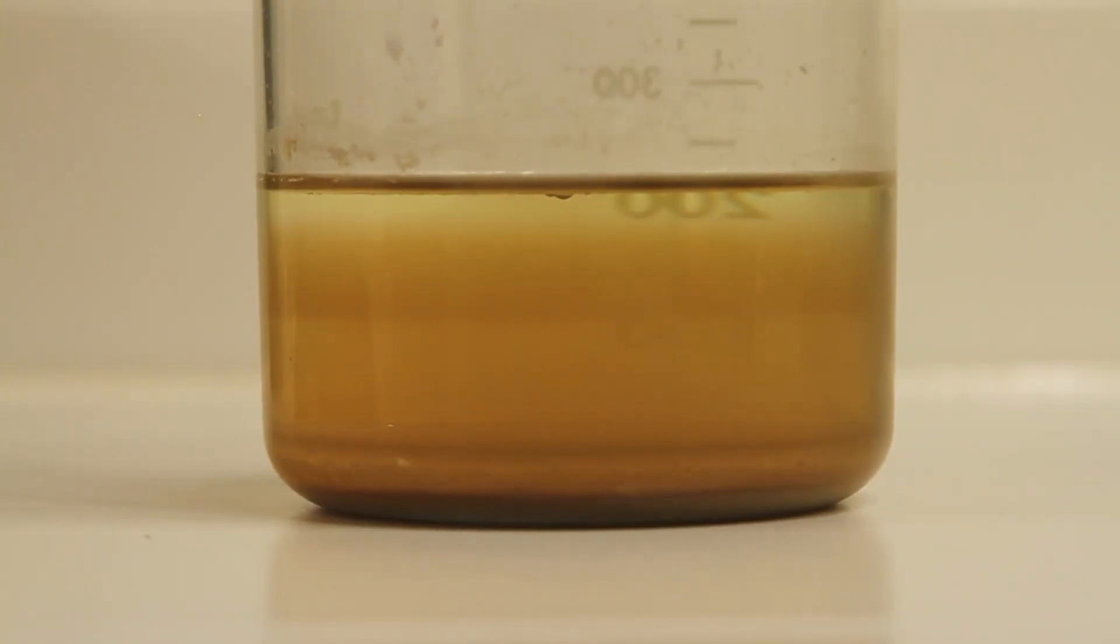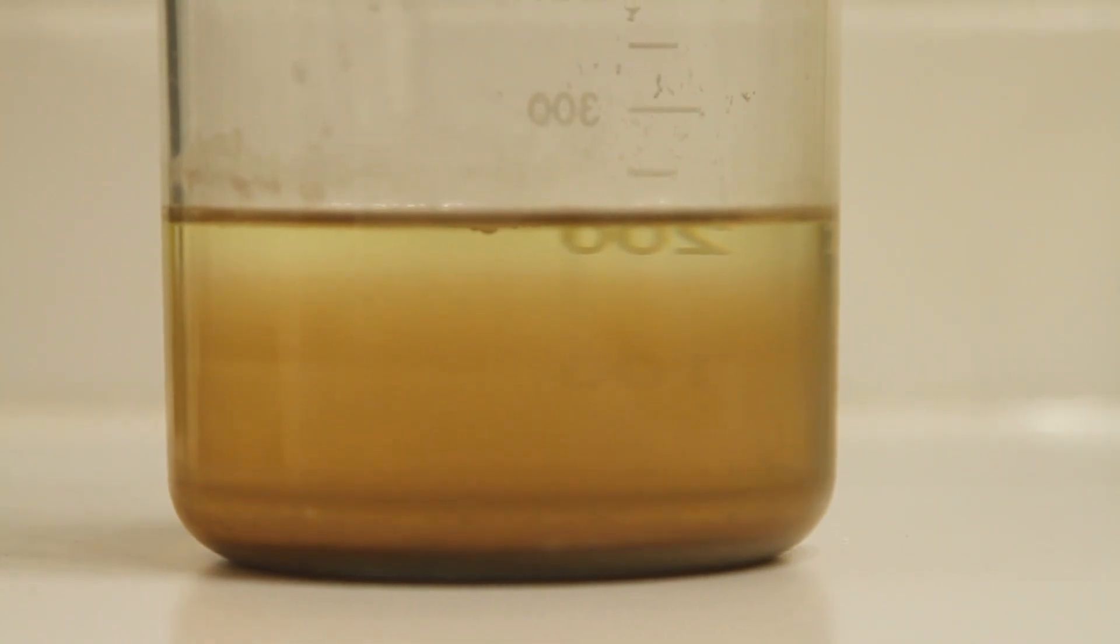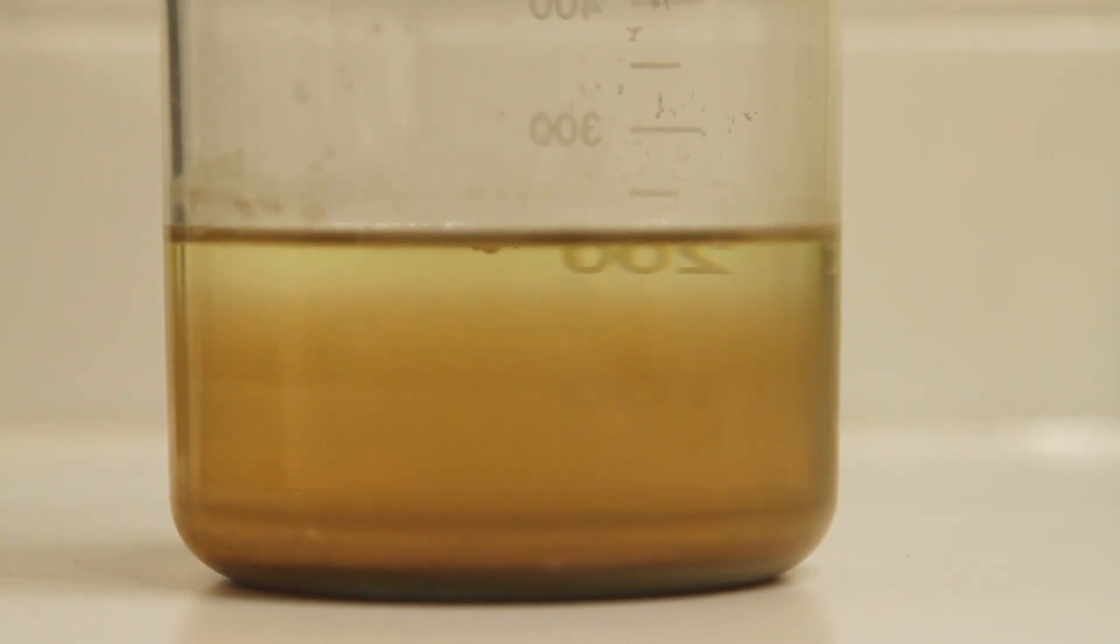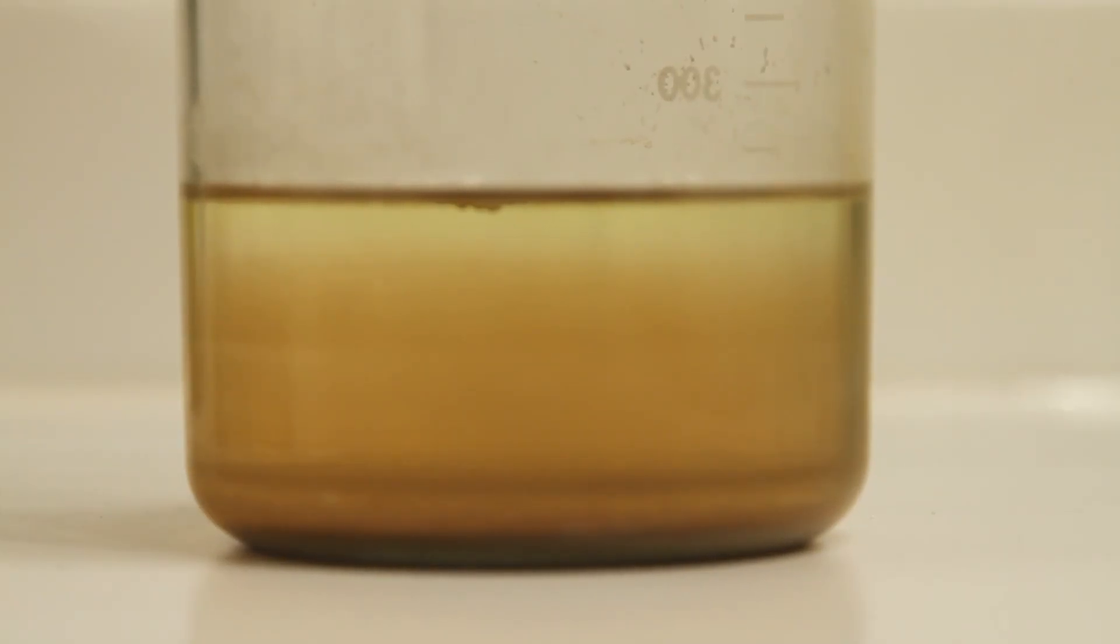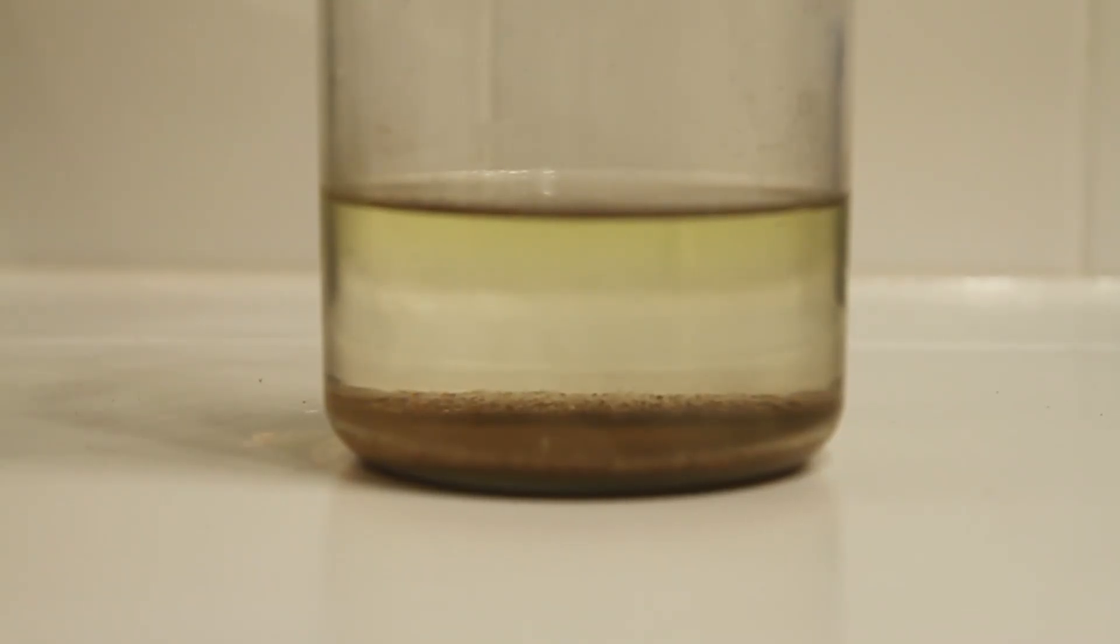And now here you'll see after about one hour of the precipitate settling, this is after two hours, here is after four hours, and this is six, and then here is after 24 hours. So it's completely settled out minus just a little bit floating around.